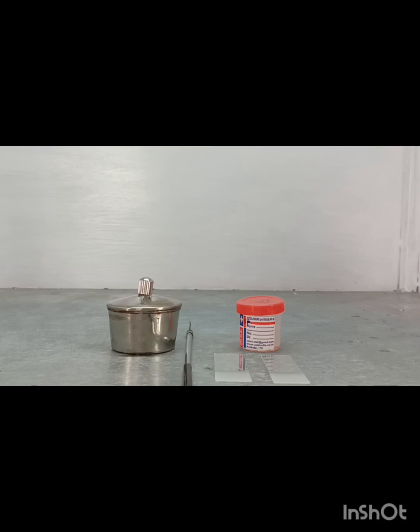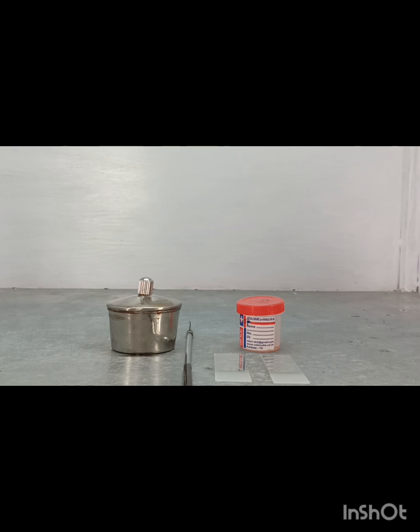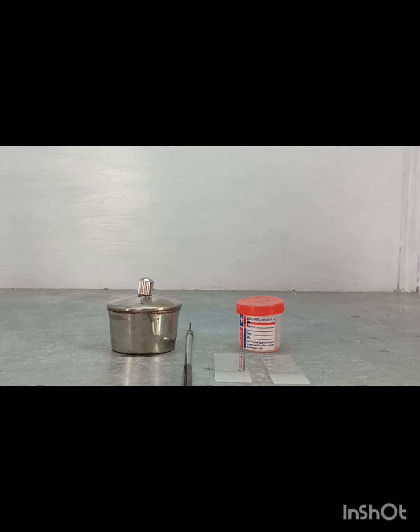Today we will perform ZN stain, meaning Ziehl Neelsen stain, and it is also called AFB stain, meaning acid fast bacilli. This stain is important for the isolation or diagnosis of Mycobacterium tuberculosis. Before ZN staining, we have to prepare a smear.